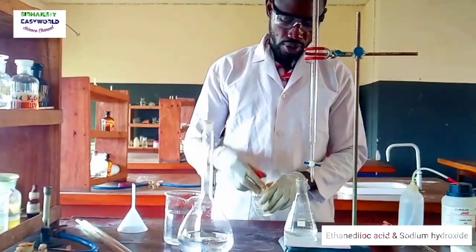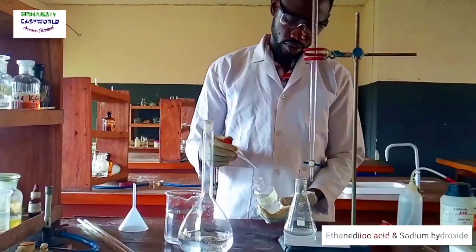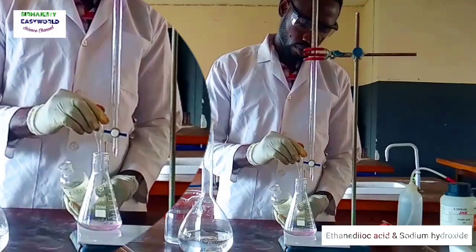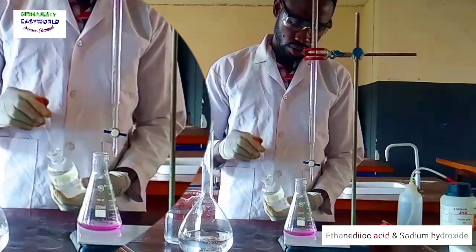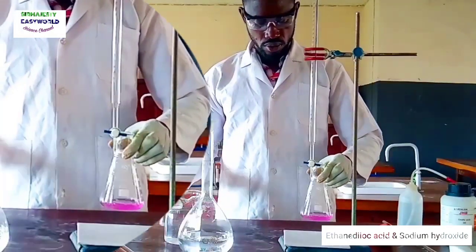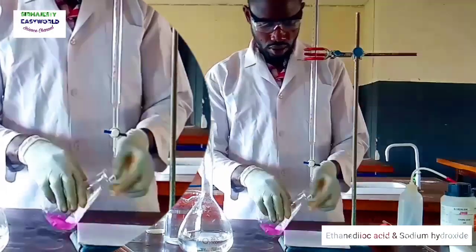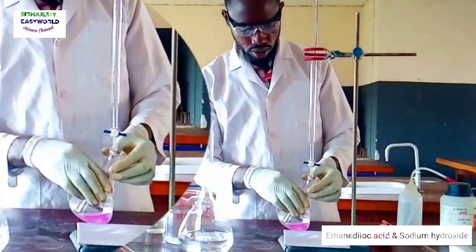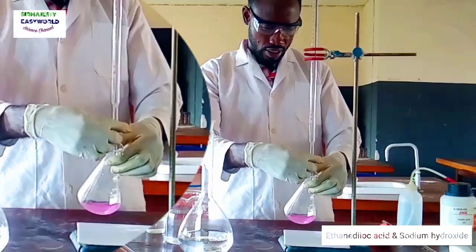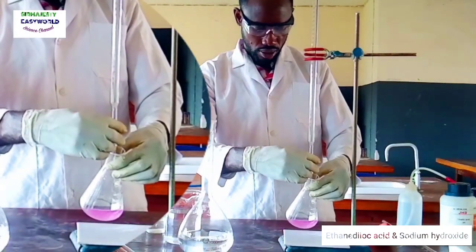I have to add my indicator. Looking at that neutralization — it will turn from pink to colorless at the endpoint.